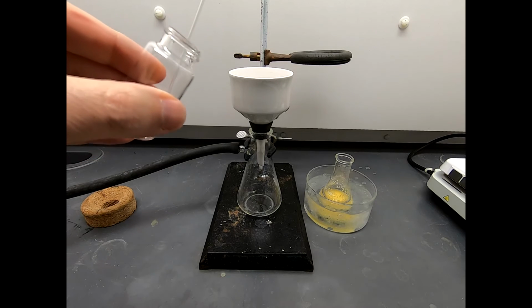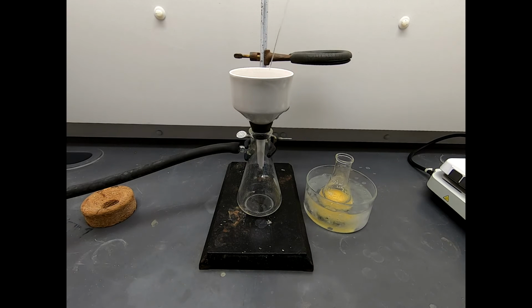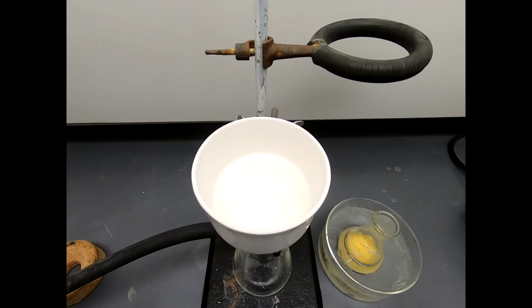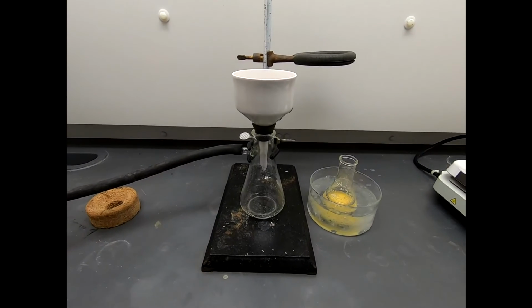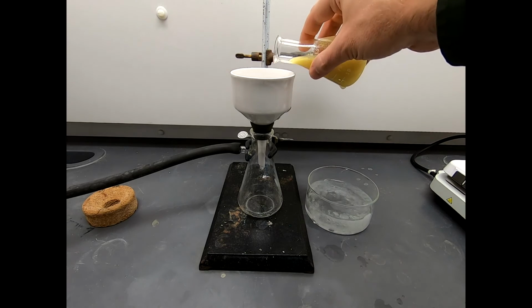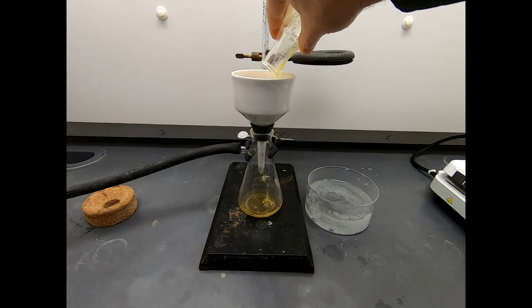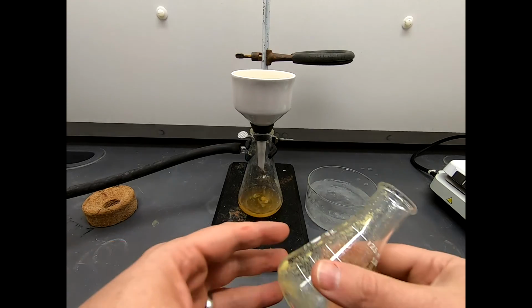and squirt this in on the filter paper. With this microphone, I don't know if you pick it up, but the suction is on. Let's get everything wet. Let's take the camera and look inside and see. Okay, all of our holes are covered up. That looks good. Now we are ready. Swirl this around and do our filtration. And that is some thick material going in. So look in the bottom, all the color is coming through.